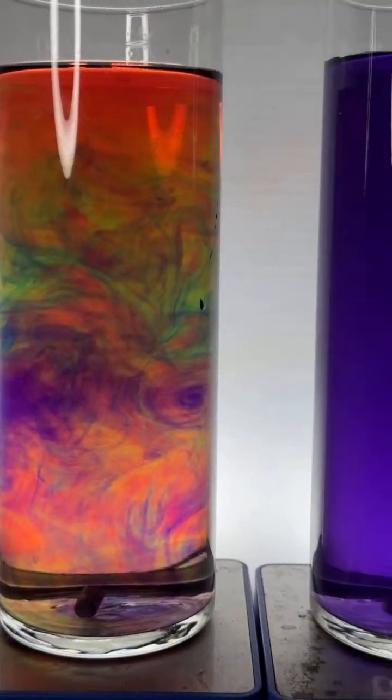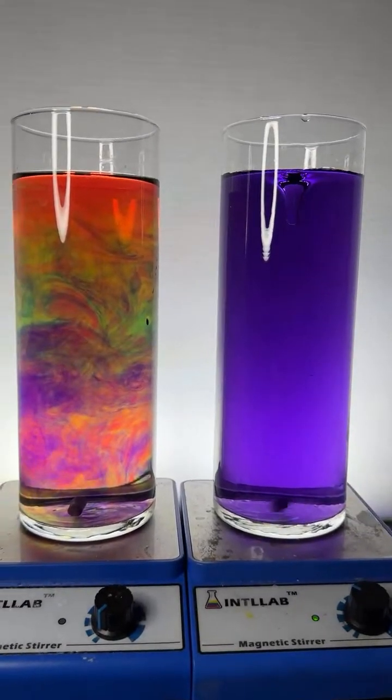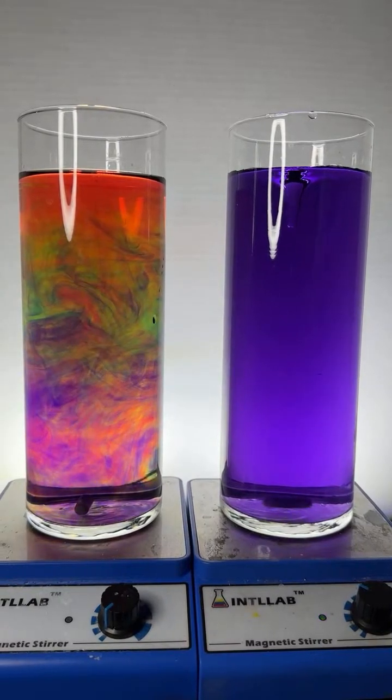Very cool. Over here, man, look at that over there. We got like a pH of 10. Let's add some acid to this, get it going back down.